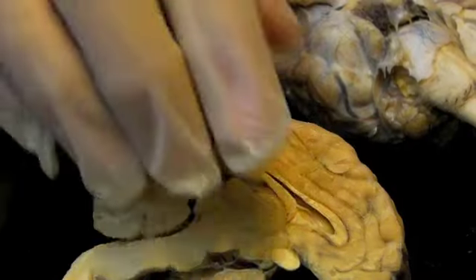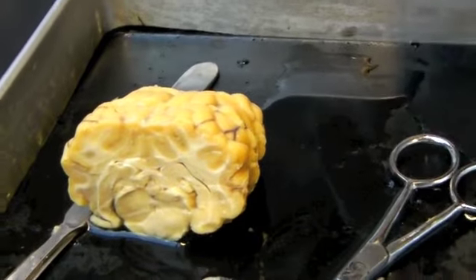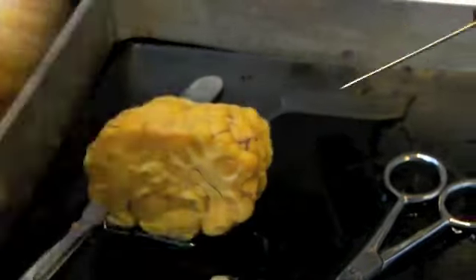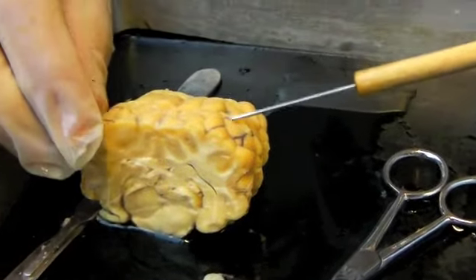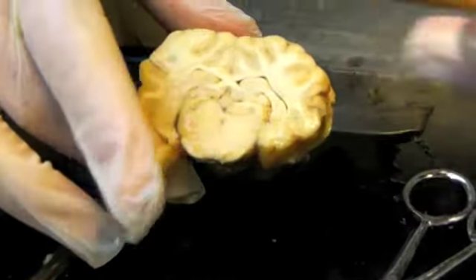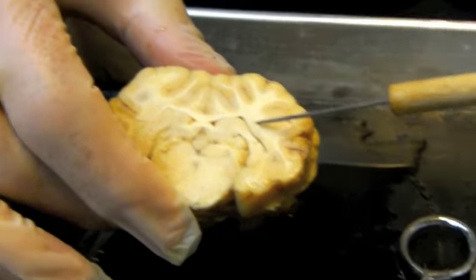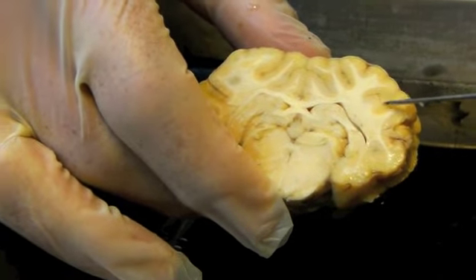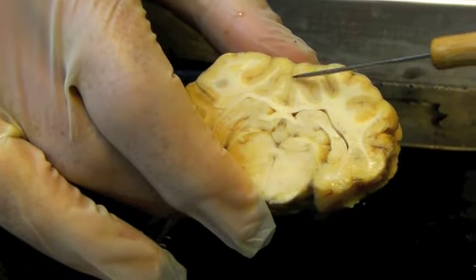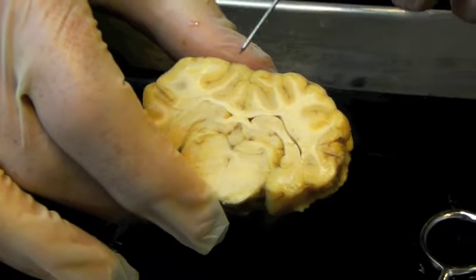Now I just want to show you a few transverse sections. Actually, I'll switch to another. This time I cut the brain across, I'm sorry, in a coronal frontal section. Some sections of brain. And you can see nicely the white matter tracts, and the cerebral cortex is gray matter. It's gray matter, all this. The longitudinal fissure is here.